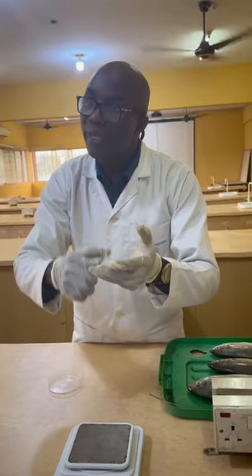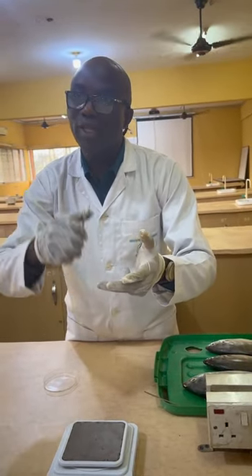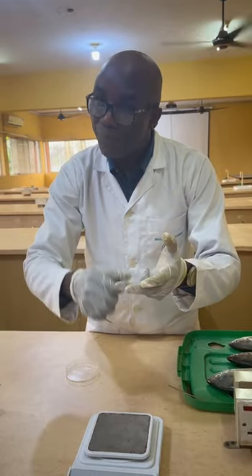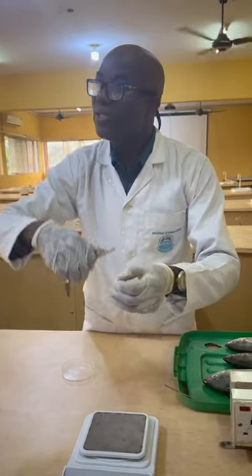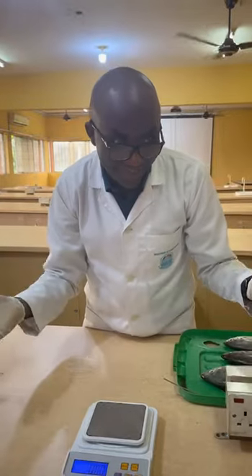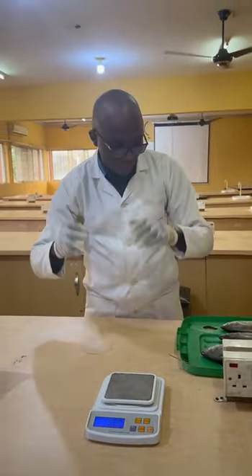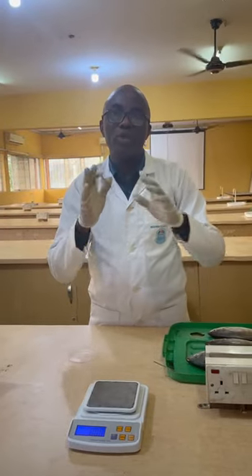Is it immature? Is it developing? Is the gonad ripening? Is it ripe? Is it ripe running? Is it spent? Is it recovery and resting? You understand? So these are things that we have taught in class, which we can also check in some other videos. So what we are going to do is that, still working by the specimen.